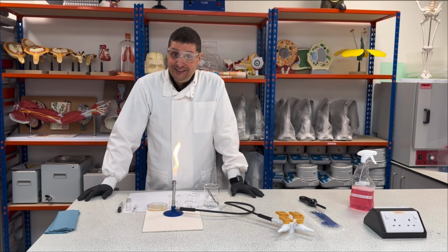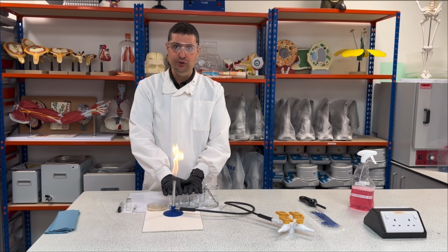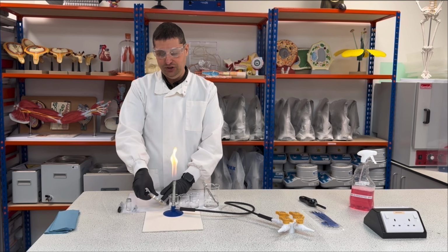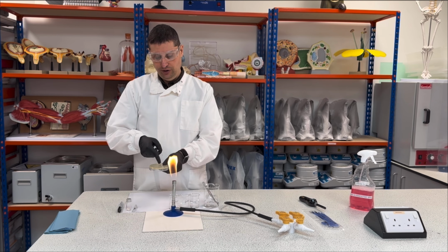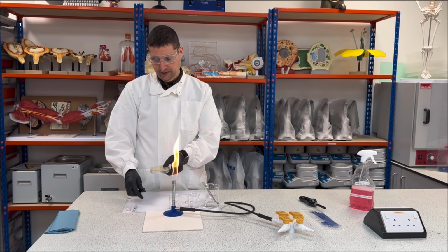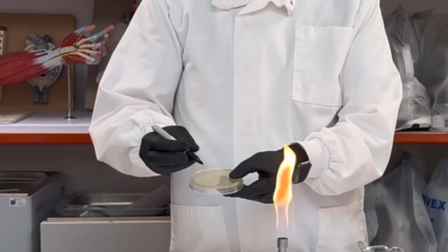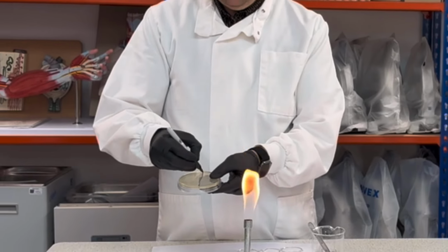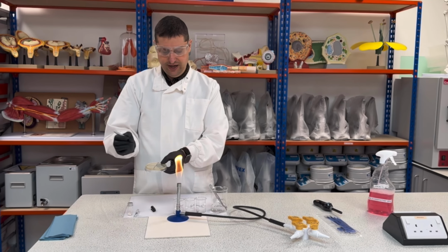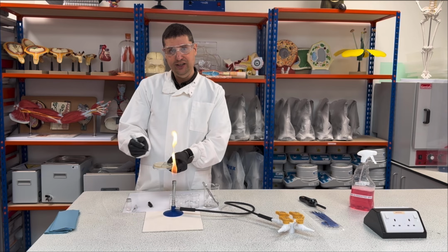So after the inoculation, now it's time to place my substances in the Petri dish. So initially I need to draw a cross in the Petri dish, dividing my Petri dish in 4 parts. So I draw a line here and another line here. Okay? And then I will label what will be in each part.